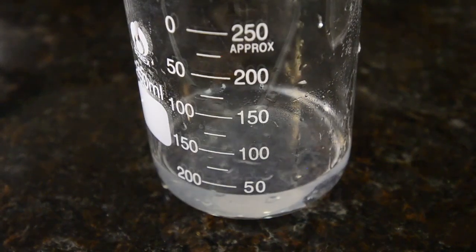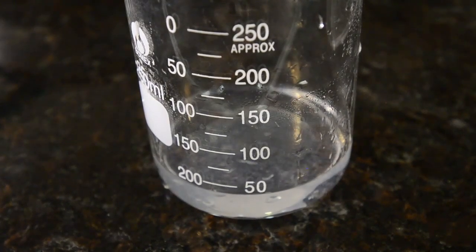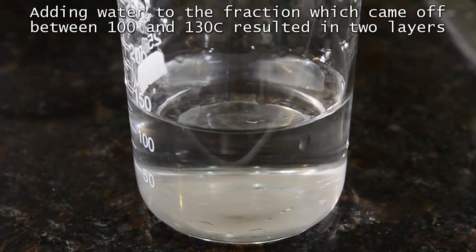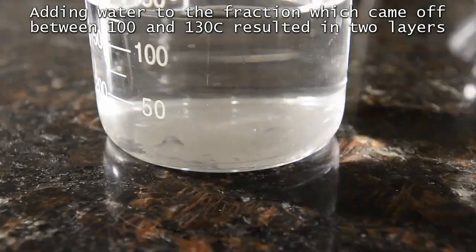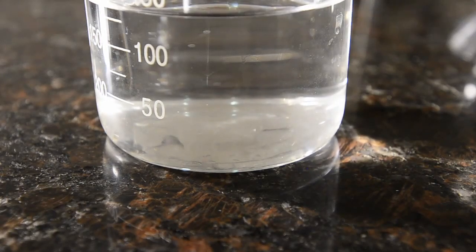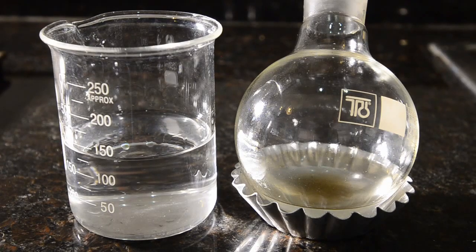Here's our first fraction, which came off above 100 degrees. On adding water to this, we noticed that a bottom layer formed. It's a little difficult to see because the color is very close to the water. And on the right, here's our slightly off-colored fraction, which we collected over 135 degrees.